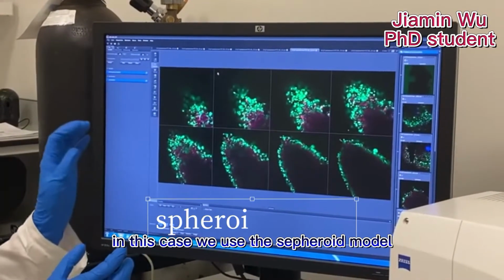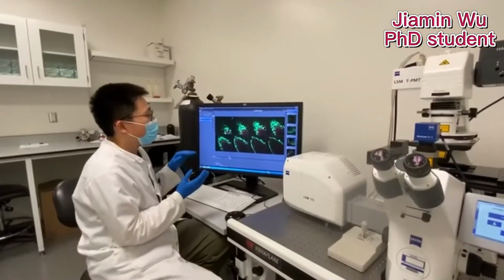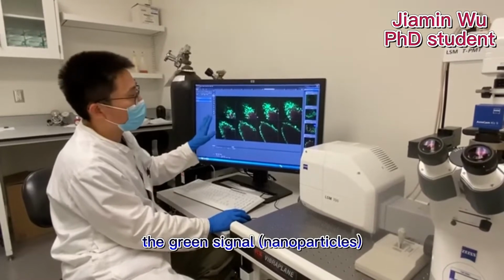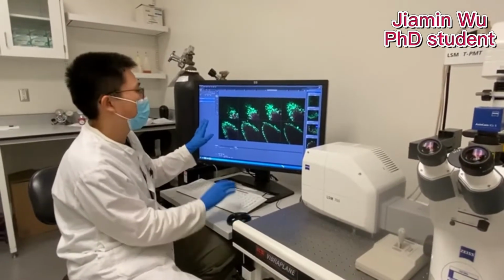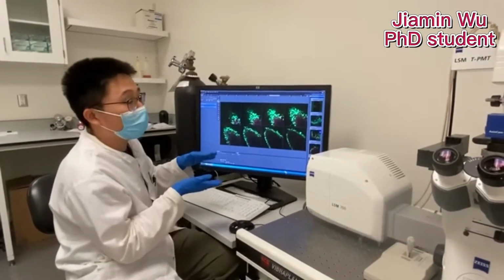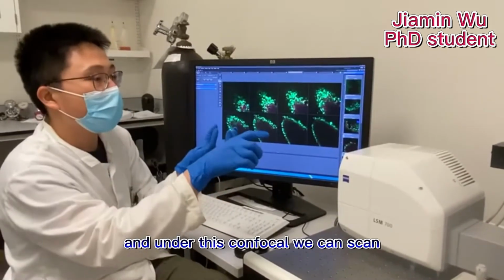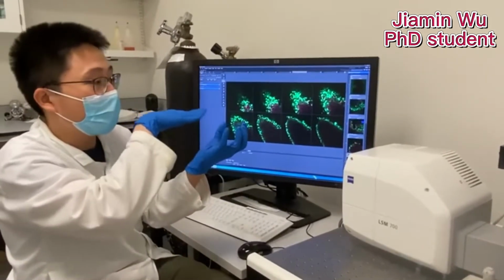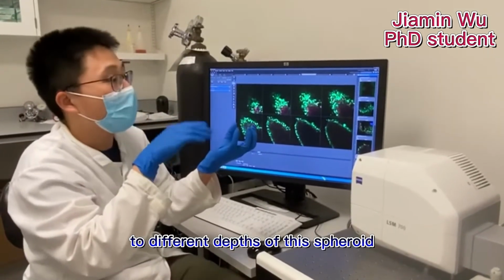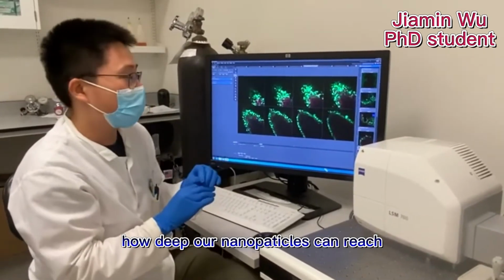In this case, we're using the spheroid model. It has multiple cell layers, and by using confocal, we can know how the green signal, which is our nanoparticle, distributes into the different layers, because we have a spheroid. Under this confocal we can scan different layers from the surface to different depths of this spheroid, so that we can know exactly how deep our nanoparticles can reach.